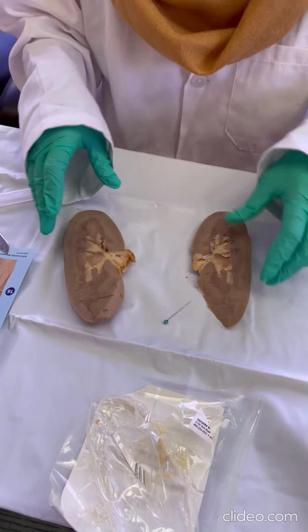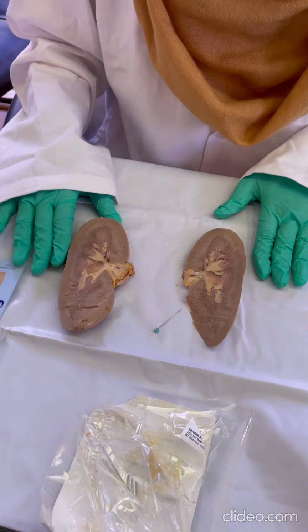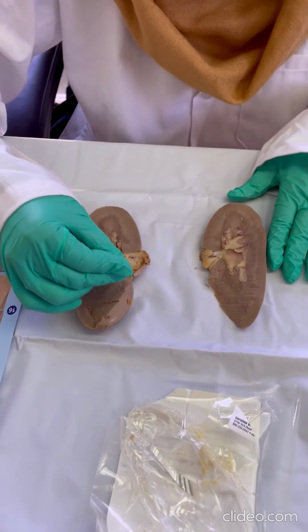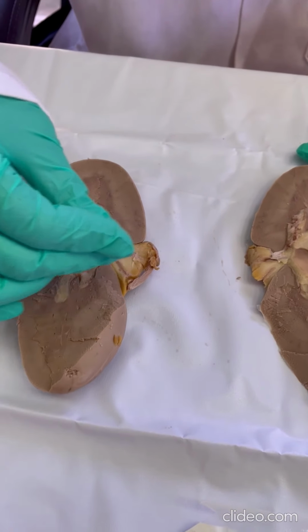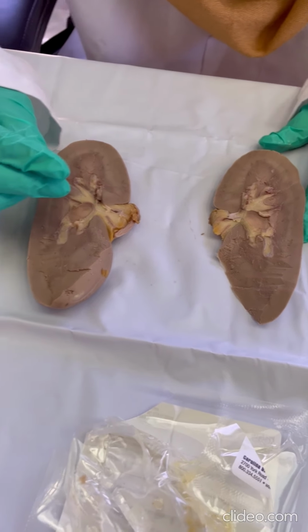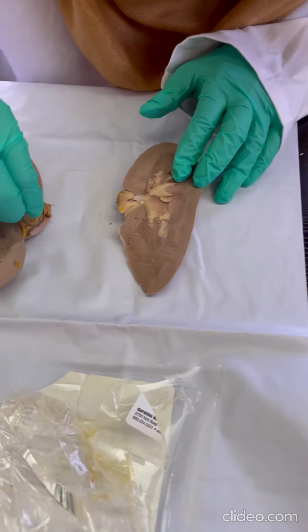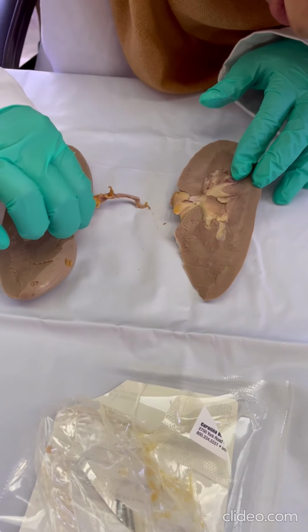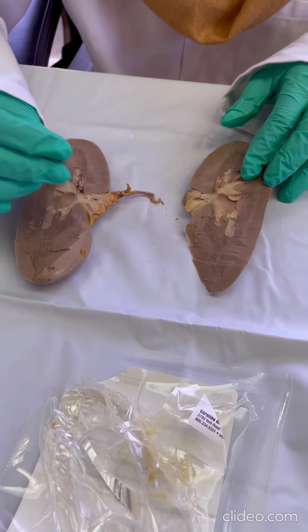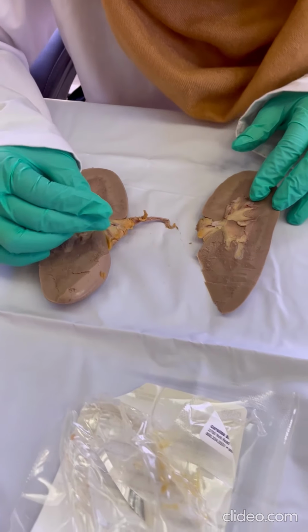Okay, so this is the kidney. I'm going to start showing you some parts of the kidney. Over here, this is the medial concave part of the kidney, and in it is located the hilum, which includes the ureter. I'm not sure which one's the ureter. It's really smushed together and not easy to tell, but it contains the ureter, the renal arteries and veins, some lymphatic vessels, and nerves. It's all in this area over here.